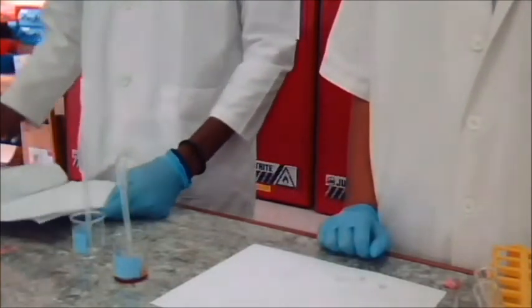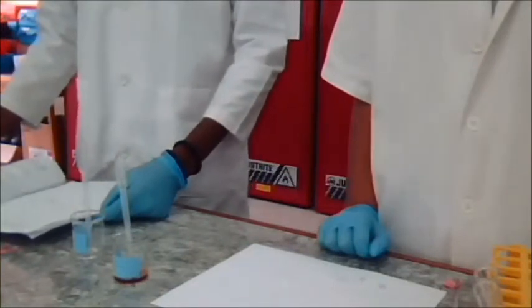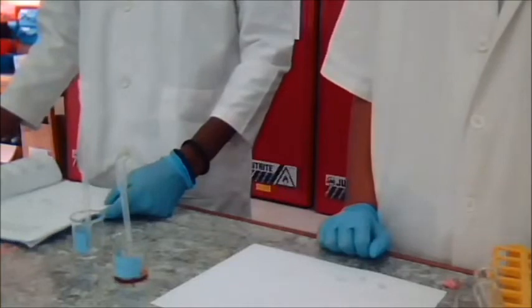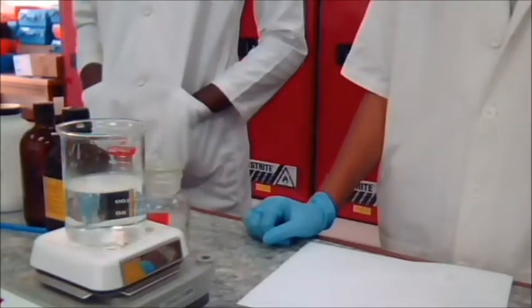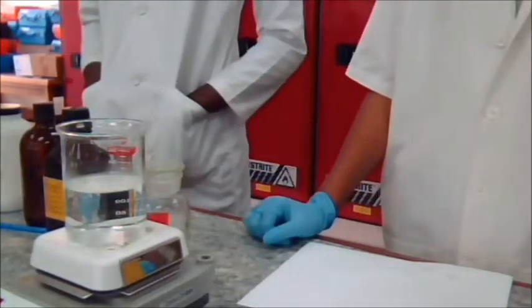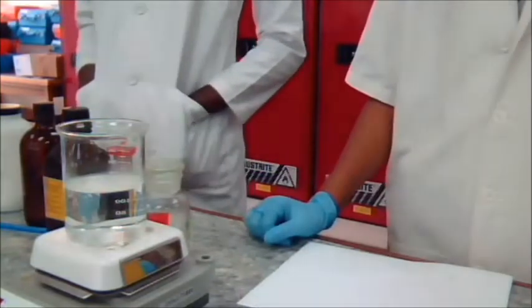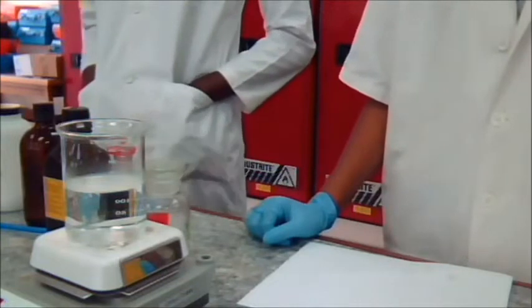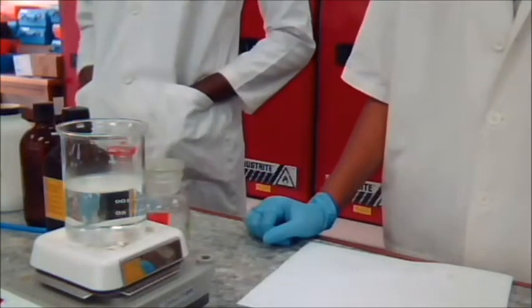According to our chart, if the compound is insoluble in HCl, it can be either an aldehyde or an alkane. Now we're going to do silver nitrate tests for halides and carboxylic acids. We have two known compounds. We're going to use 1-bromobutane and benzoic acid.